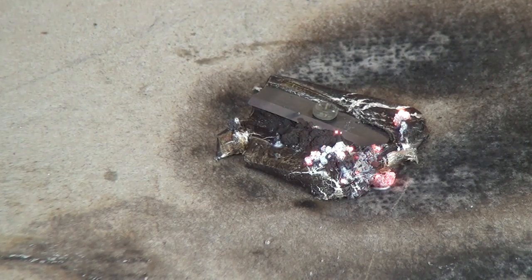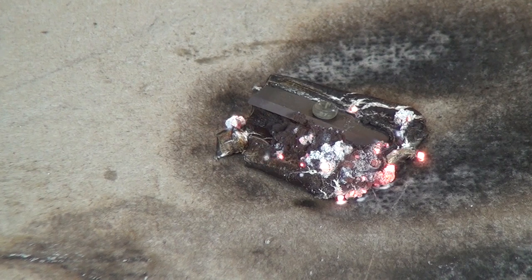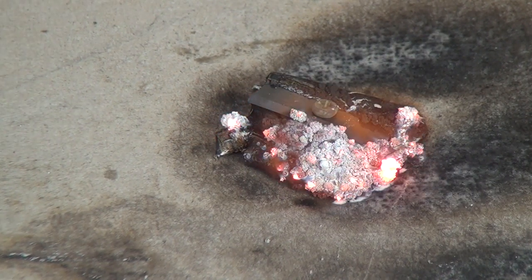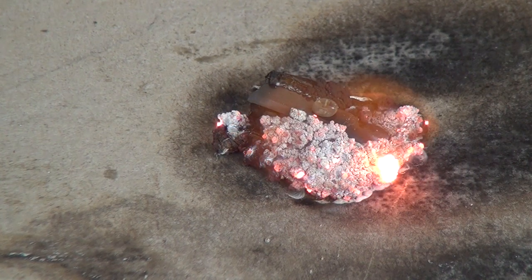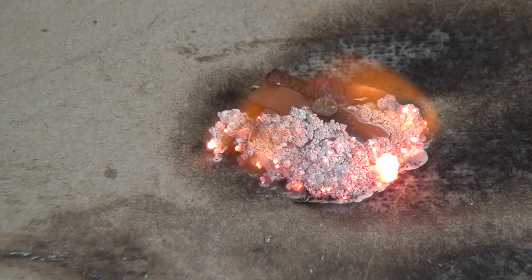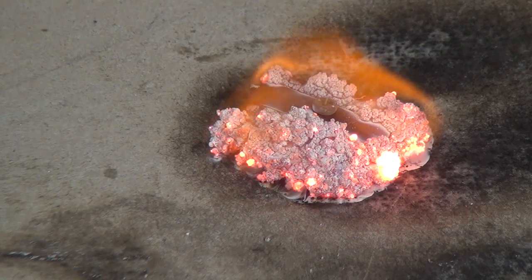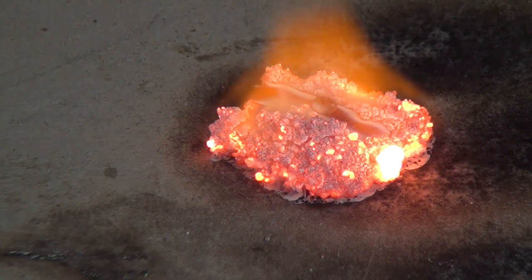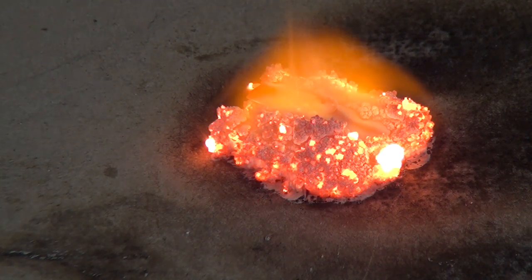Just see it starting to ignite. Look at that. It's now starting to burn. It's going from the elemental magnesium. Look at the energy coming out.